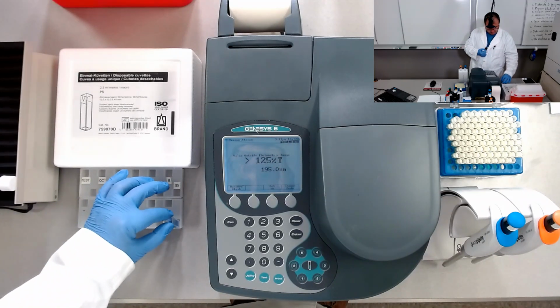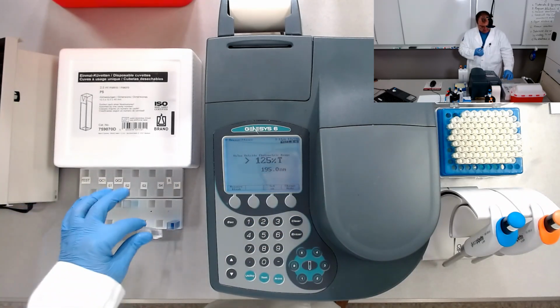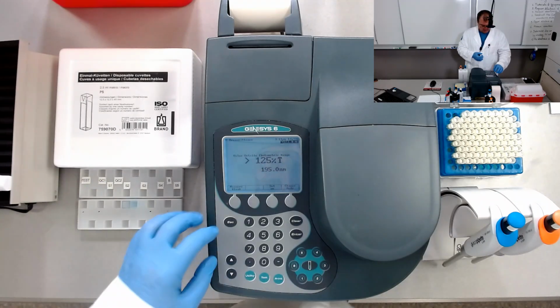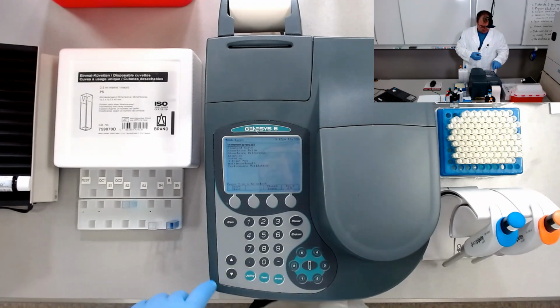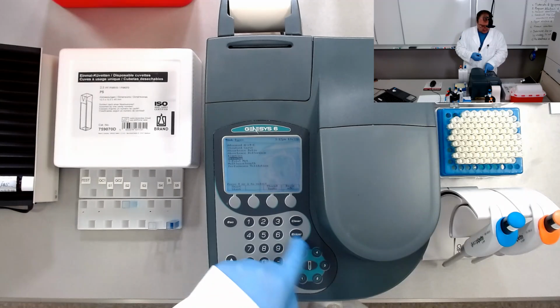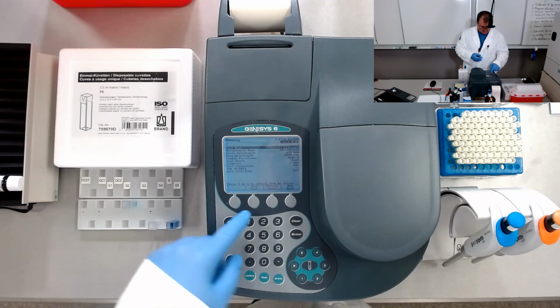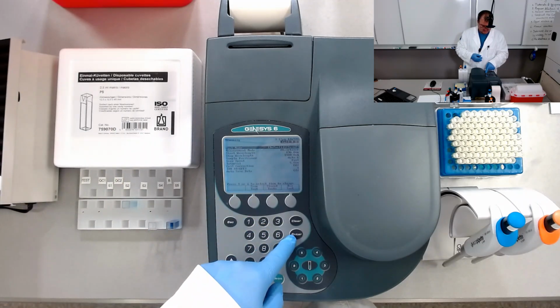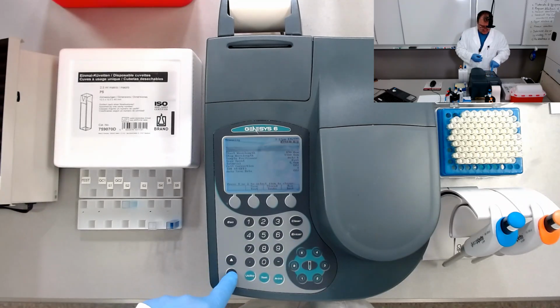We are going to have in here the sample, and we have in here the blank, the distilled water as blank. We have the instrument in here. We'll go and in test, go to scanning. Okay, again, enter. We're going to the test name. So the name is the one that we saved before, one in absorbance mode.